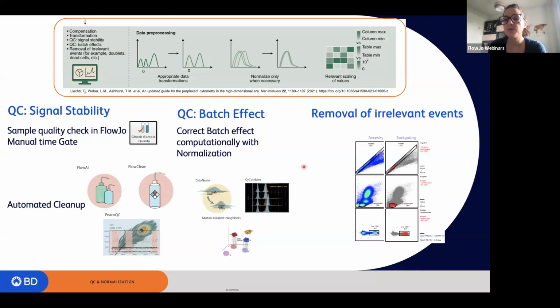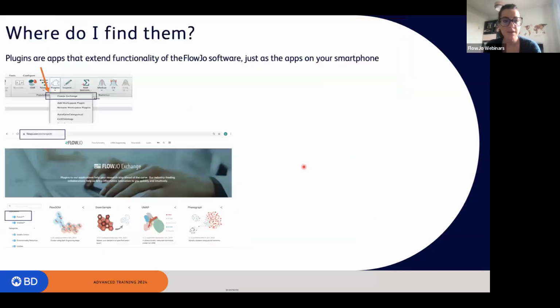And after that, you want to remove all irrelevant events such as doublets, dead cells, or debris, and so on. So where do I find all these algorithms that are available in FlowJo? If you open up your FlowJo and you go under Workspace plugins, you will see that there is a line on top, even if you have never downloaded anything like that, that says FlowJo Exchange. If you click on that, you will be taken to our web page, which is indeed the FlowJo Exchange, the web page where we have available all the different algorithms.